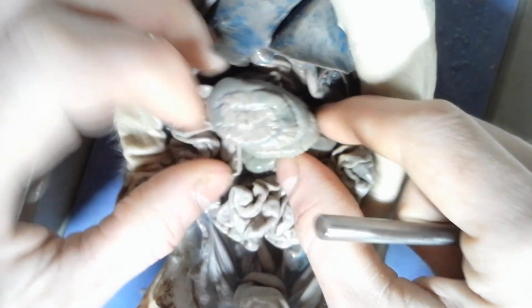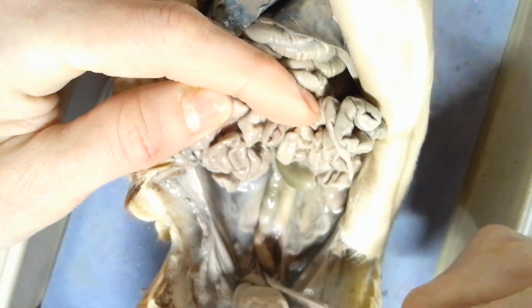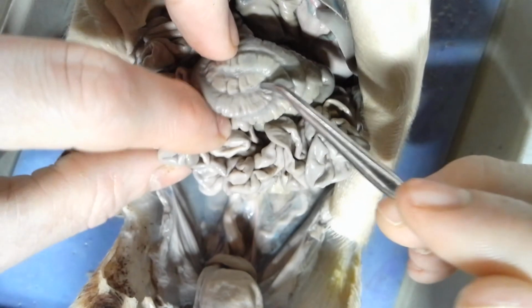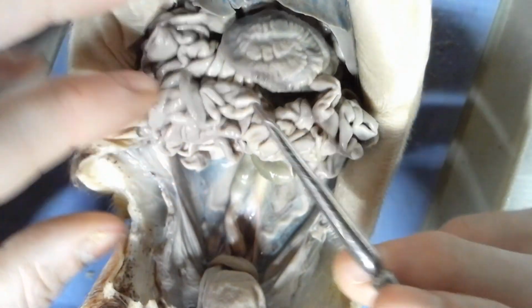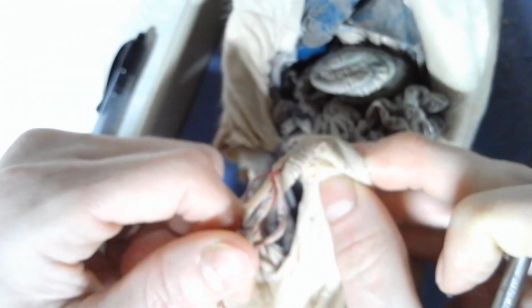Alright, so again, this is the large intestines here. Now if I extend the large intestines down, you see how it straightens up and goes straight down towards the anus. This is the rectum. So the rectum is the straight part of the large intestines. So it comes up from this clump right here and works its way down. Okay, looking at what else? See here, the umbilical artery and umbilical vein. So the umbilical cord. Okay, so the umbilical cord is actually very much on the outside here. So this is the umbilical cord hanging off right here.